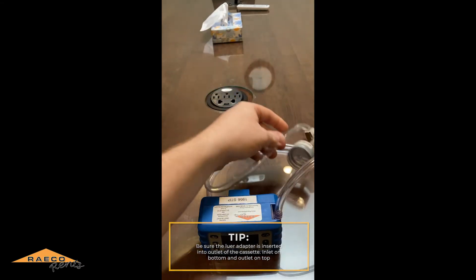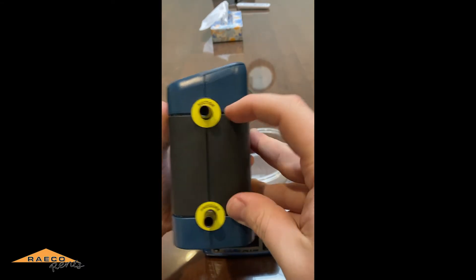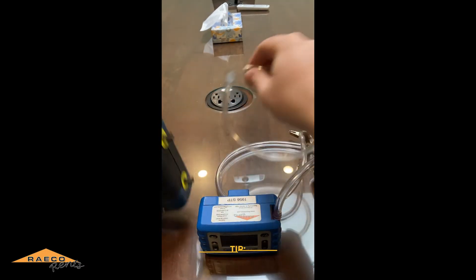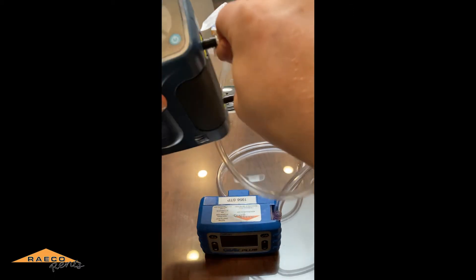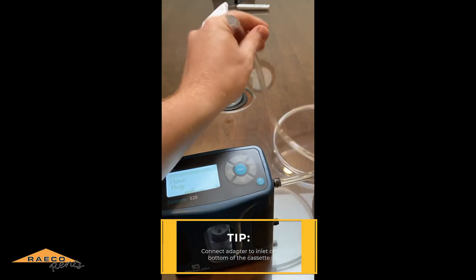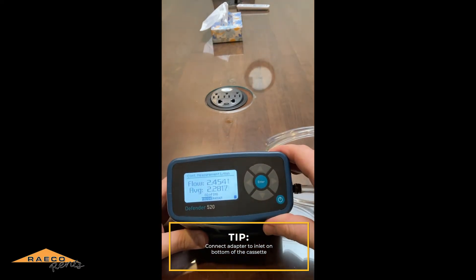Now we have that set. There are two different ports on the BIOS Defender — you can calibrate with things that are either sucking air, such as this pump, or something that's pushing air like a gas regulator. We'll hook this up to the suction port, get that on, and plug it into the cassette. Already we're getting measurements on the BIOS Defender.